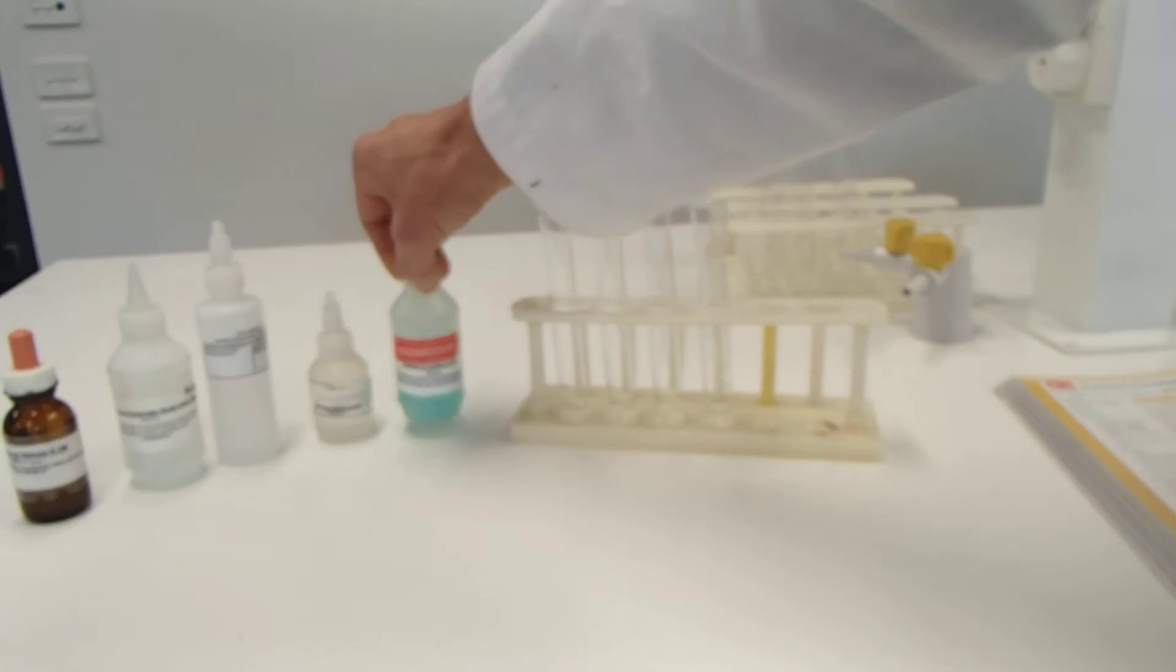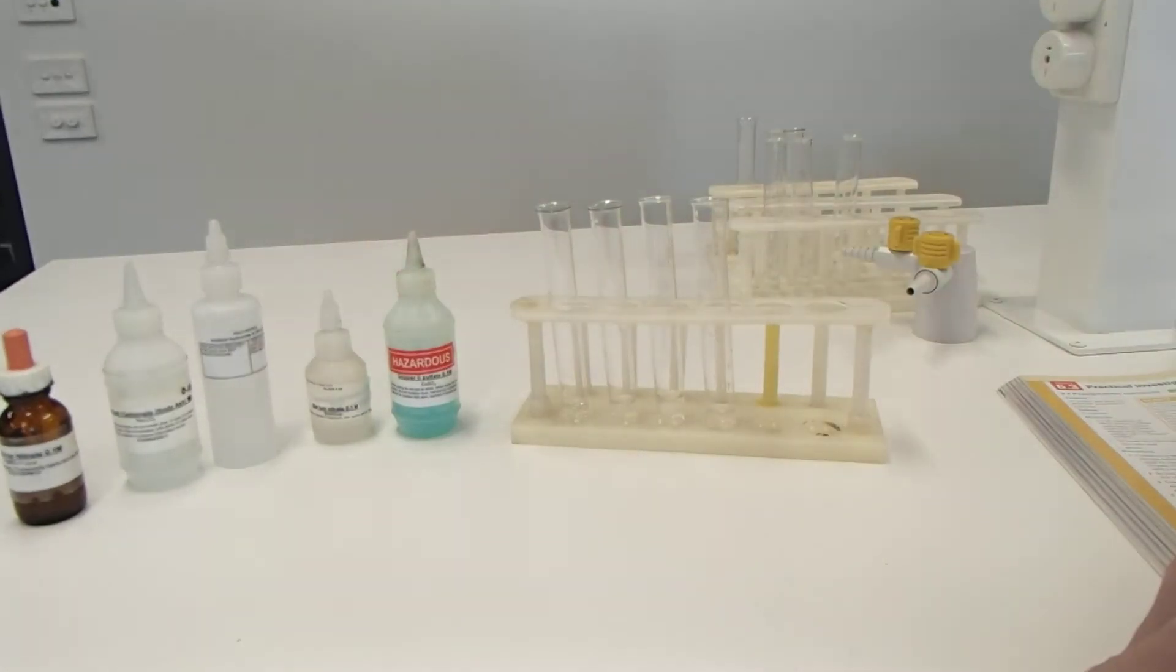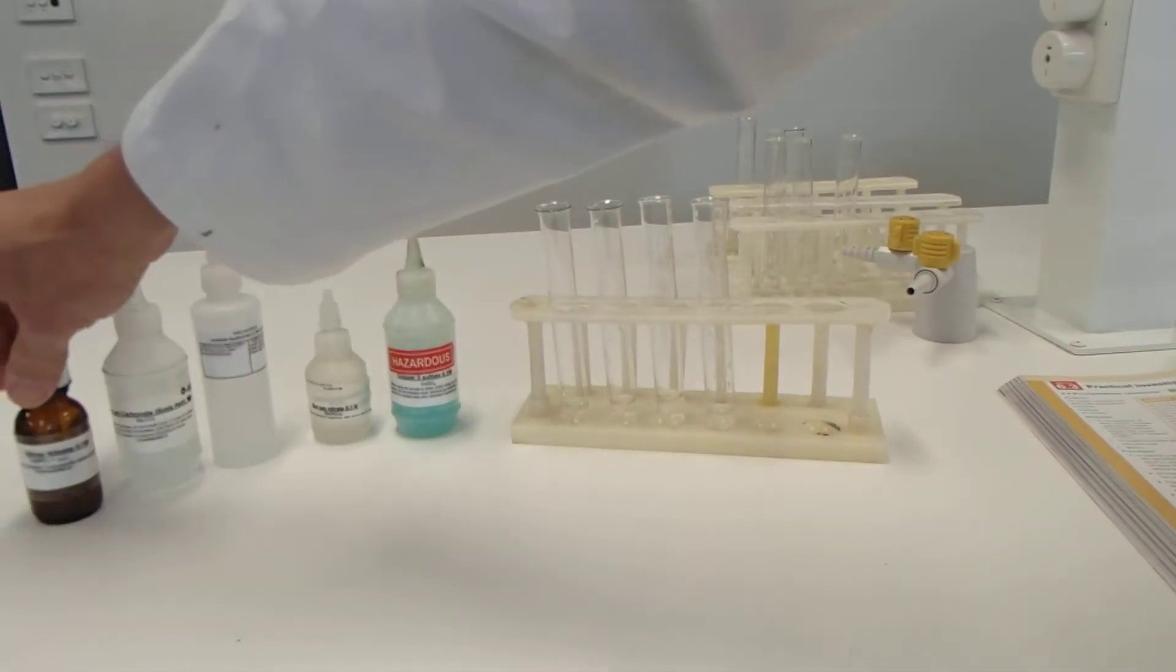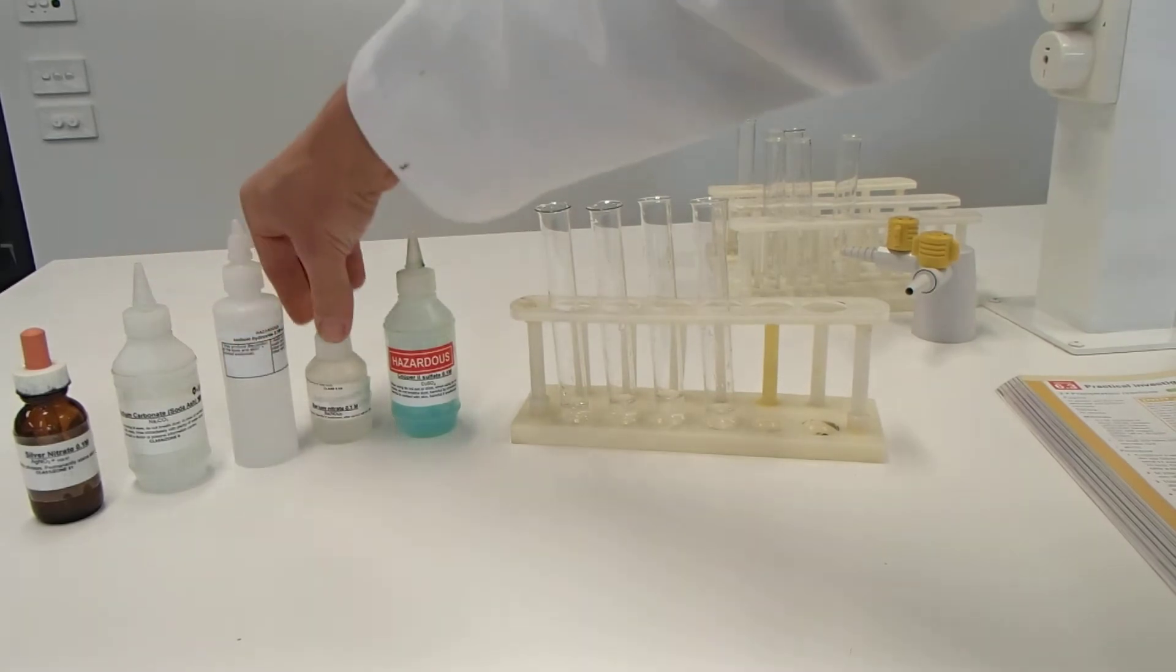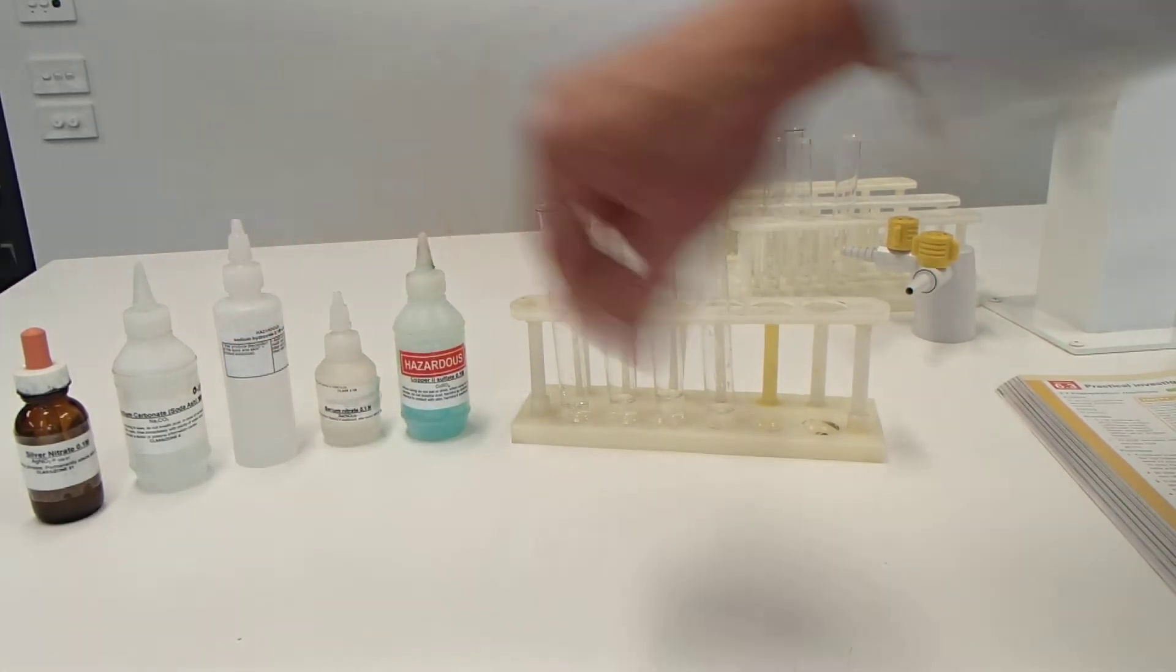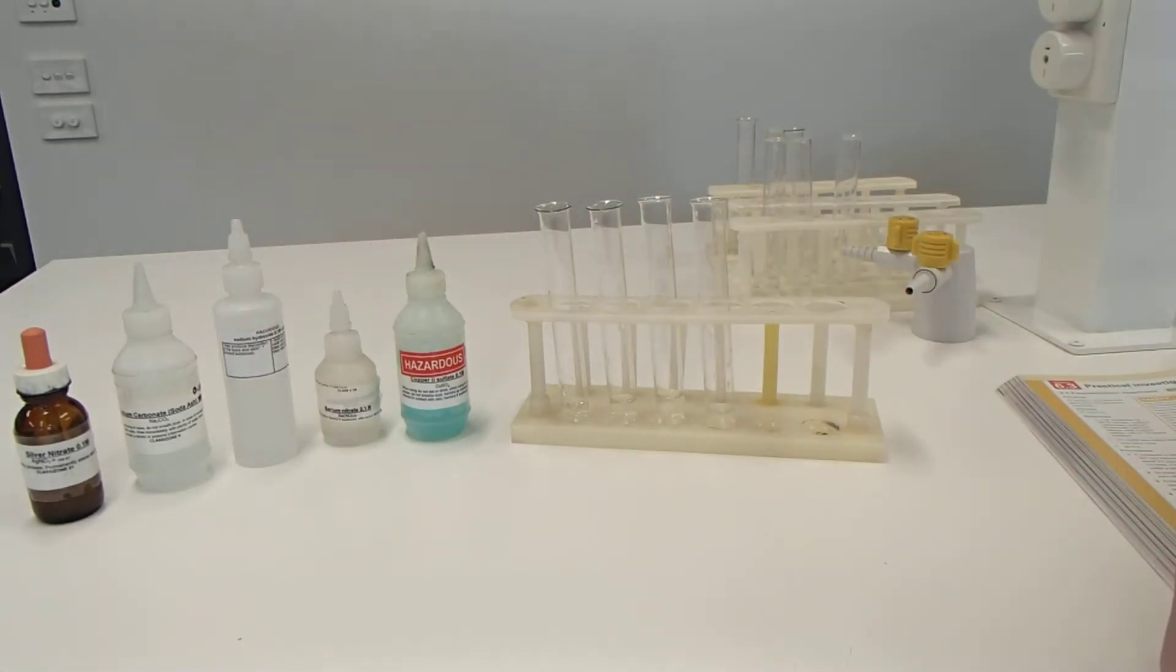So these are all solutions, meaning that they have substances dissolved in them. So there's no solids there. They're all dissolved. They have substances dissolved in them. They're solutions. They're clear.